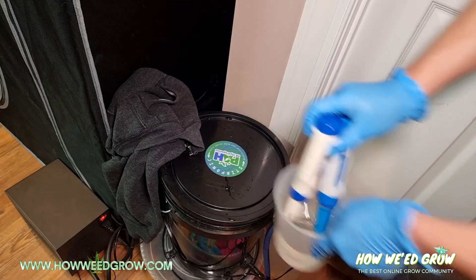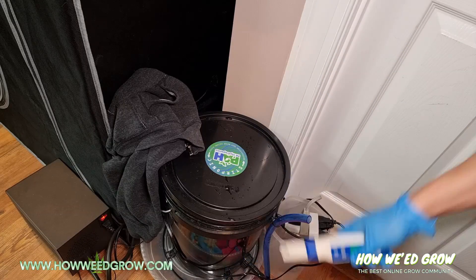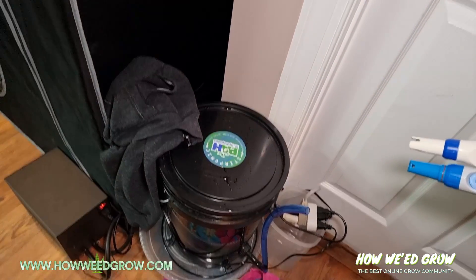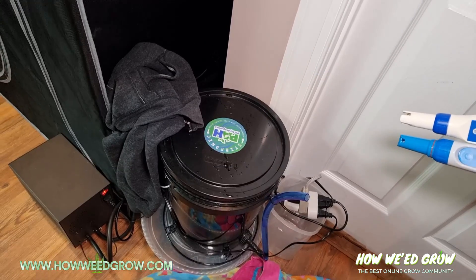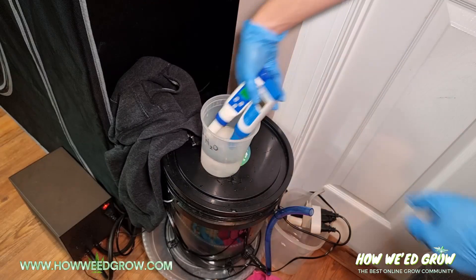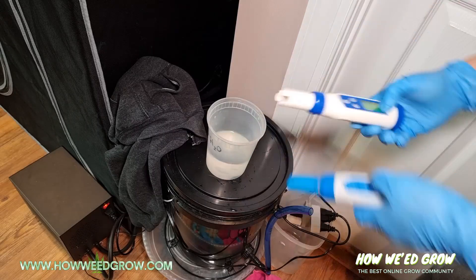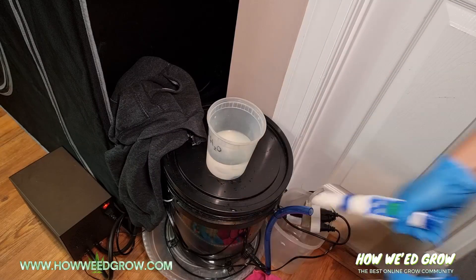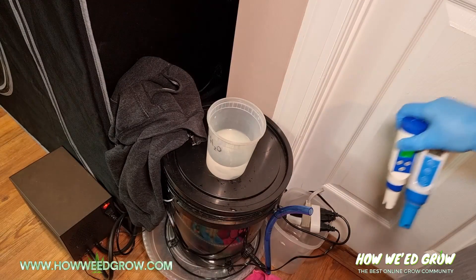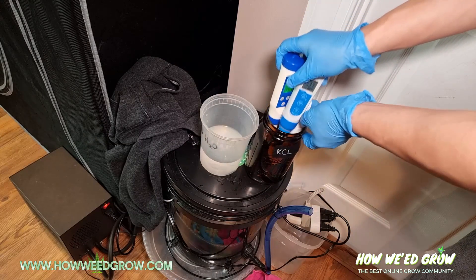Now I can take it out and shake some of that liquid off. Then rinse it in RO water again, shake off the excess liquid, and finally place it back into your KCL solution.